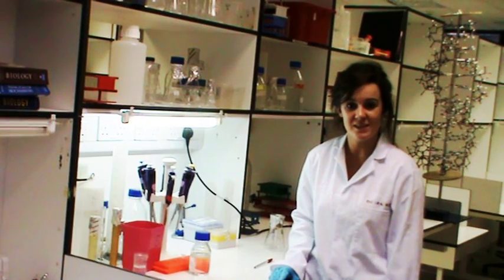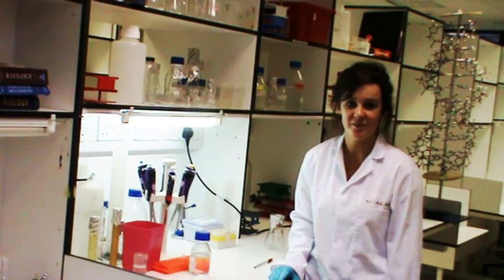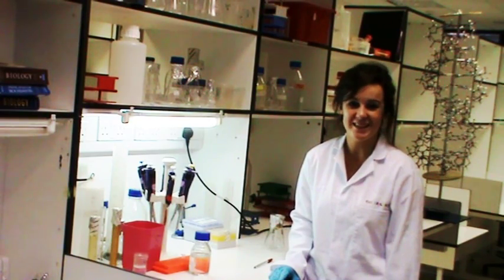There are lots of different reasons for extracting DNA in the lab. I'll tell you about some of these later. But right now, let's go get some DNA.